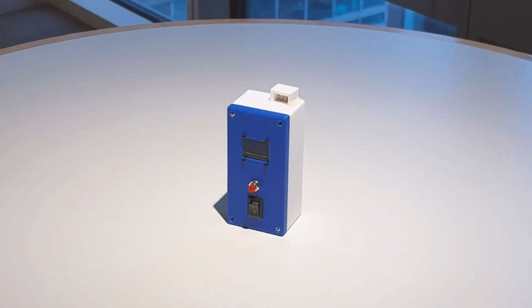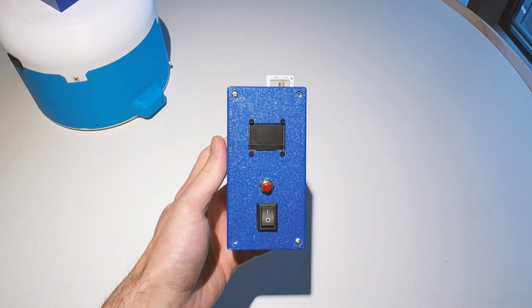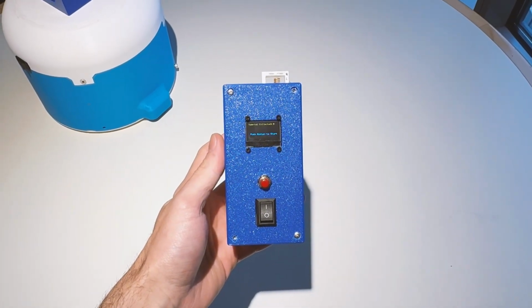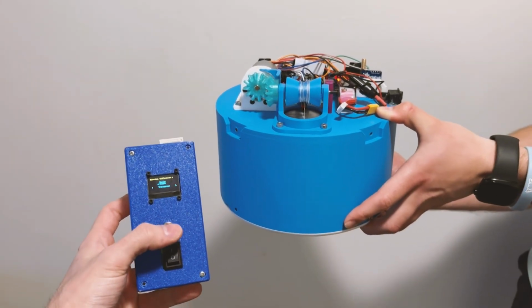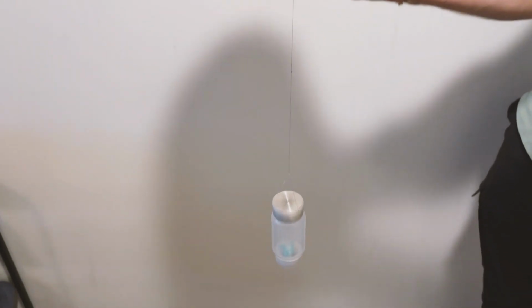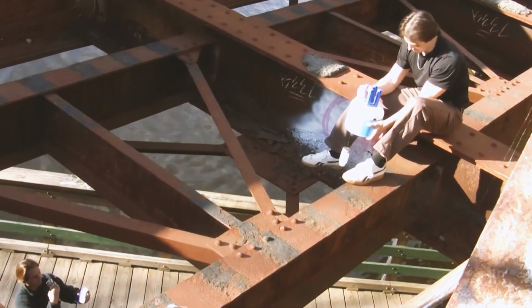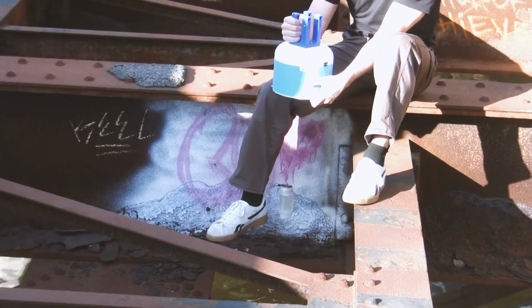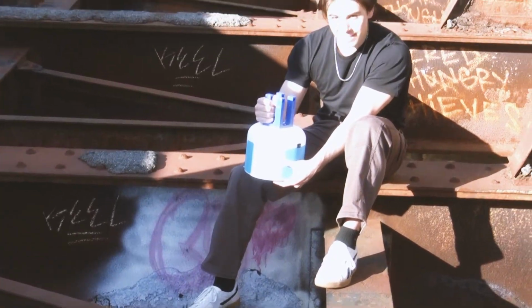The remote controller receives flight instructions on how the drone should be flown to collect the sample and displays it on an OLED screen with the number of samples collected and the triggering state of the device. The remote control has a triggering button which relays to the main device remotely when the user wants to start the collection of the sample. The logic of the main device only allows for samples to be collected when the drone device combination is within the height range and the remote start button has been triggered.